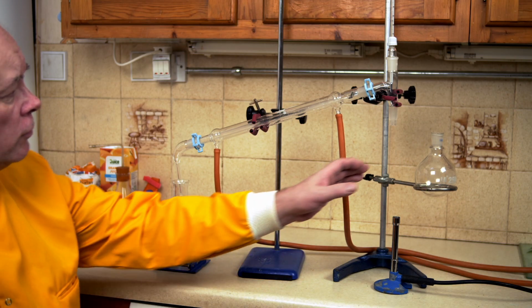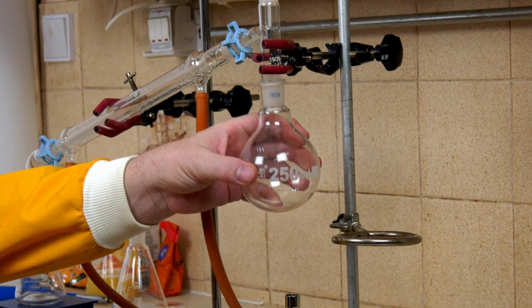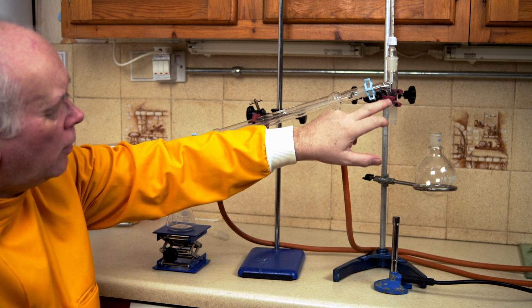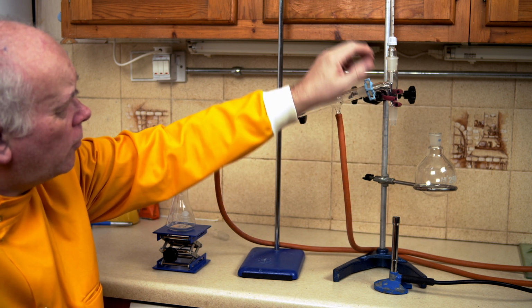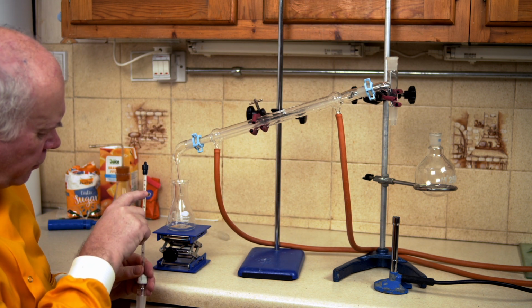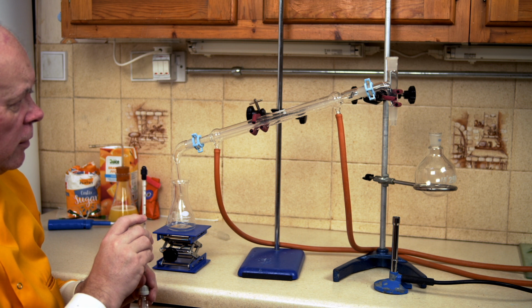So now let's have a look at the setup of the equipment. We've got our flask, which is going to contain our mixture that we're going to distill. This is a round bottom flask. It's basically easier to heat up, and at the moment it's not full, it will be in a minute when we fill it up. This then goes to a distillation head, which is a piece of tubing with a thermometer placed in it. And this thermometer goes up to 100 degrees centigrade. We're going to collect alcohol, which is going to boil at around about 80.